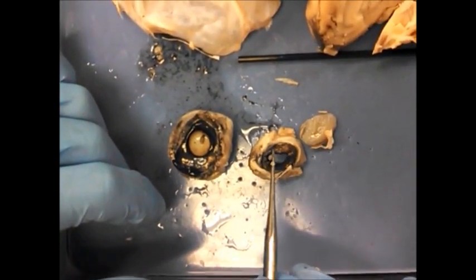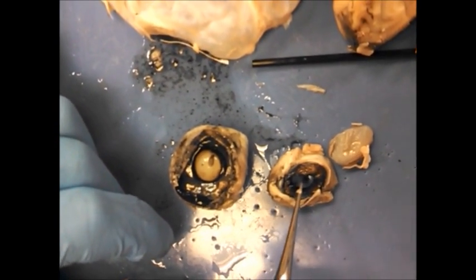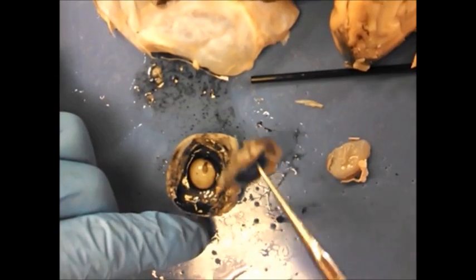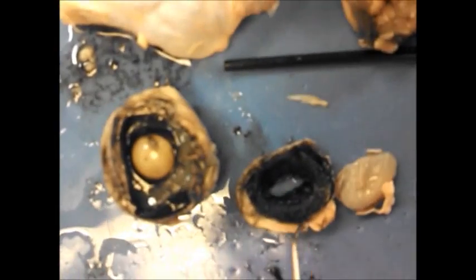The cornea and the iris — the white part's the sclera. You have a pin right through the middle, that's the pupil. You flip that over, it looks like the underside of a mushroom — that's the ciliary body or ciliary muscles.